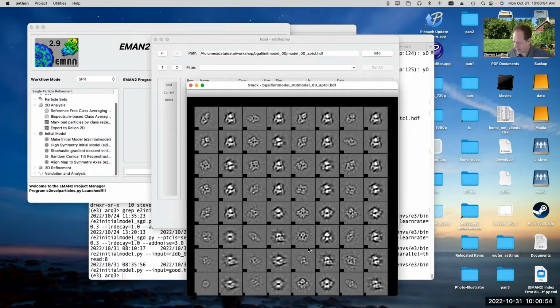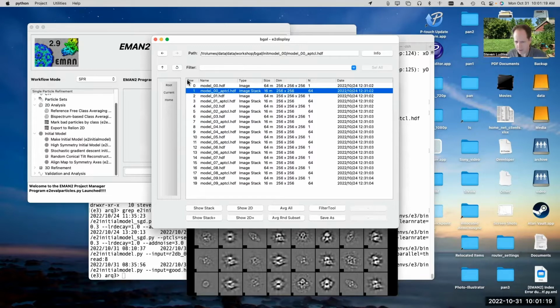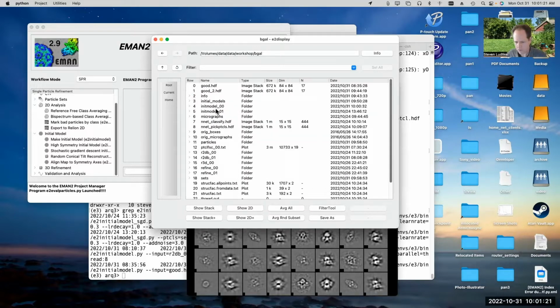This program is stochastic, meaning it only uses a subset of the particles in each iteration. So if you're going to use this program with class averages, you don't want to just give it 64 class averages. You want to give it 1,000 or 500 class averages or something like that if you want it to work well. And you can use class averages with it. It's just that you want to generate a lot of them. Alternatively, you can just throw the raw data at it. You can just skip the 2D class averaging process entirely if you want to.